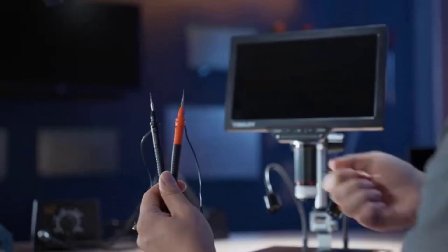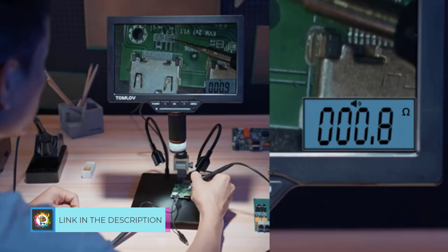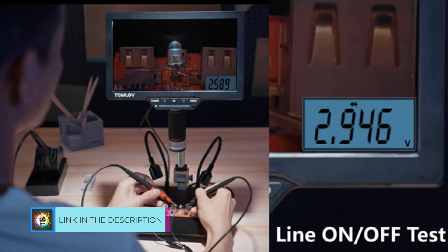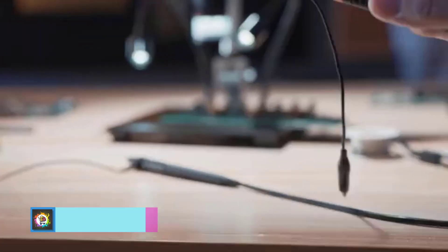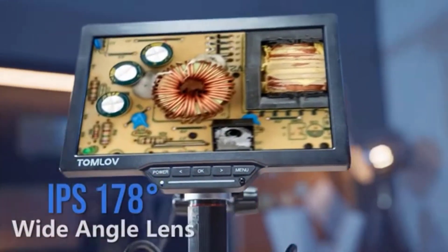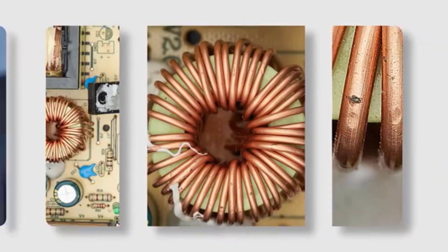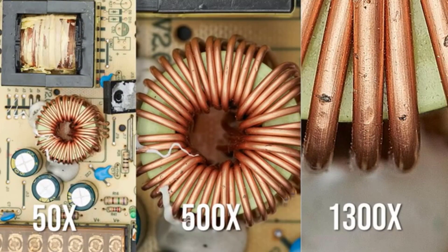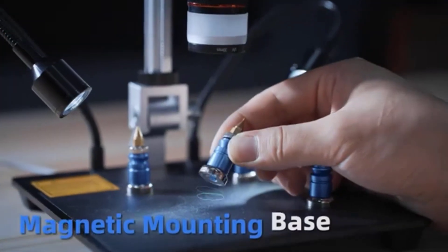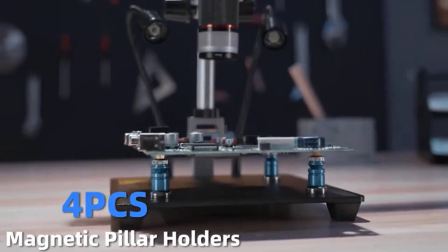LCD digital microscopes are marvels of modern technology, seamlessly blending the power of microscopic observation with the convenience of digital display. These cutting-edge instruments offer users a glimpse into the intricate world of the microscopic realm, all through the clarity and ease of an LCD screen. Whether for scientific research, educational purposes, or hobbyist exploration, LCD digital microscopes provide an intuitive and immersive experience, allowing users to capture, analyze, and share their discoveries with unprecedented clarity.